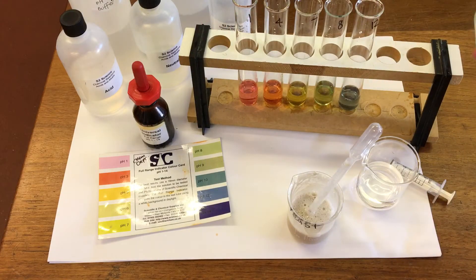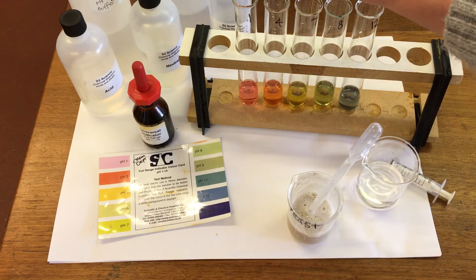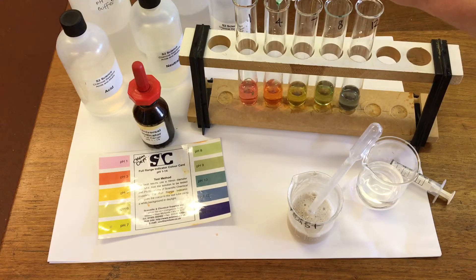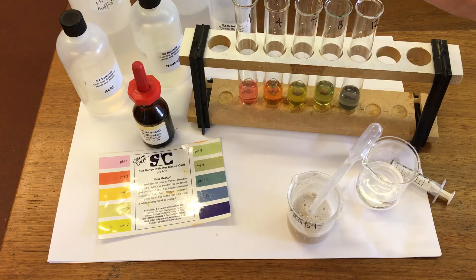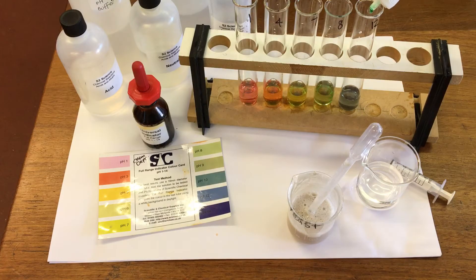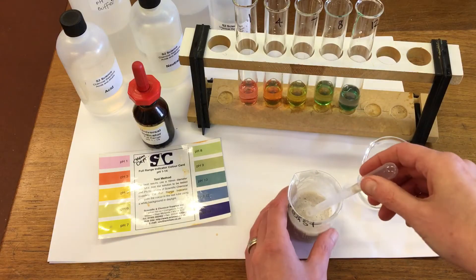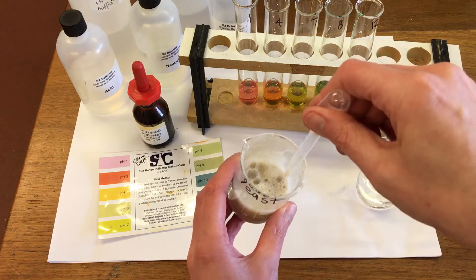And then I'm going to add a few drops of detergent to each of our tubes. And then we're going to add 1 ml of our yeast solution to each of our tubes.